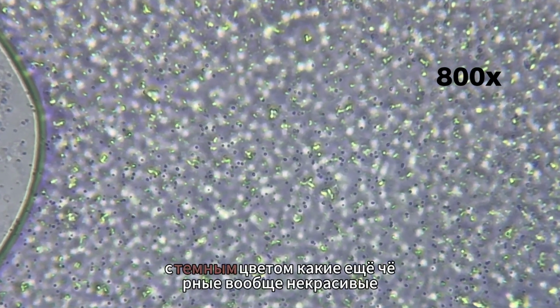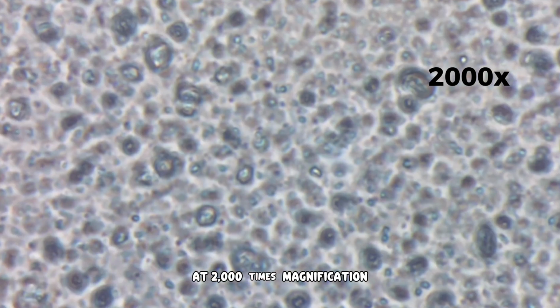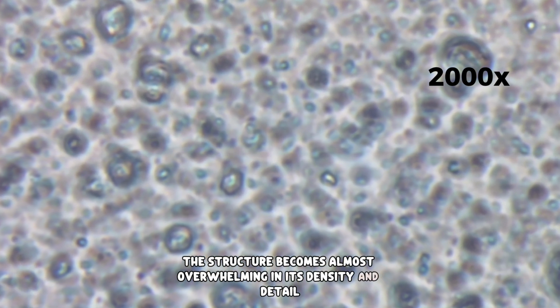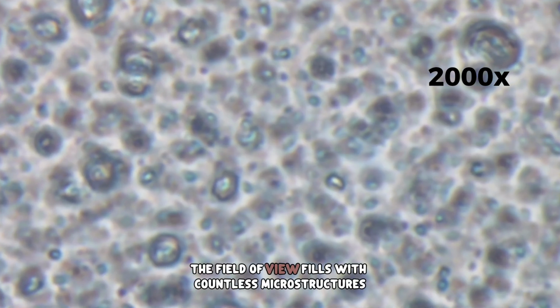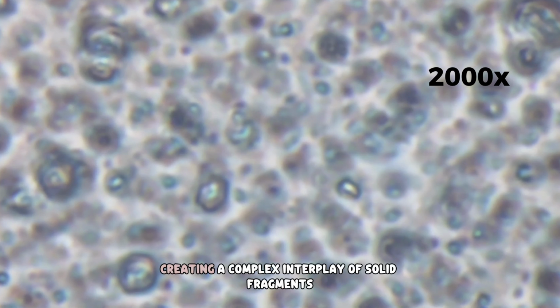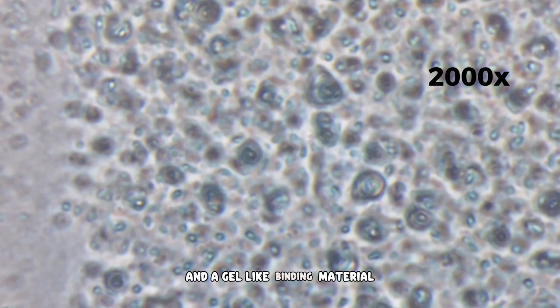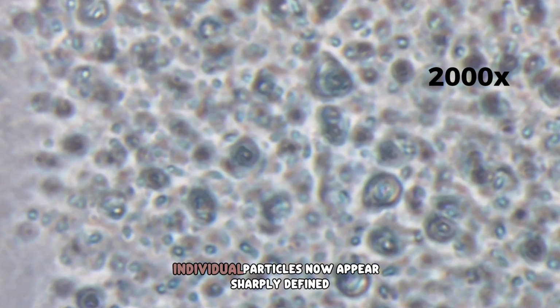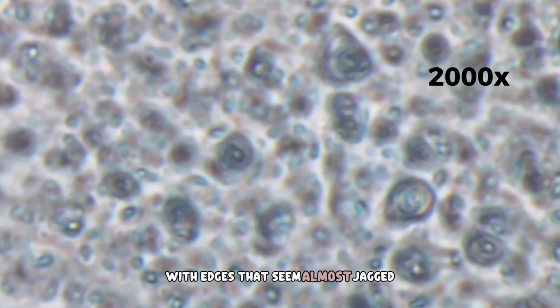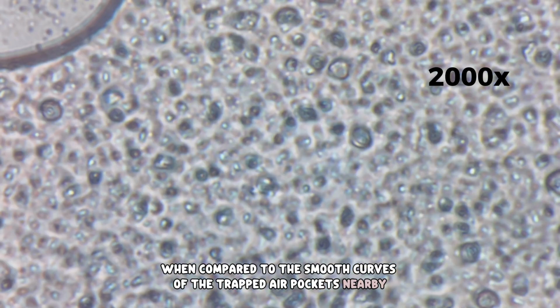At 2000 times magnification, the structure becomes almost overwhelming in its density and detail. The field of view fills with countless microstructures layered upon one another, creating a complex interplay of solid fragments and a gel-like binding material. Individual particles now appear sharply defined, with edges that seem almost jagged when compared to the smooth curves of the trapped air pockets nearby.